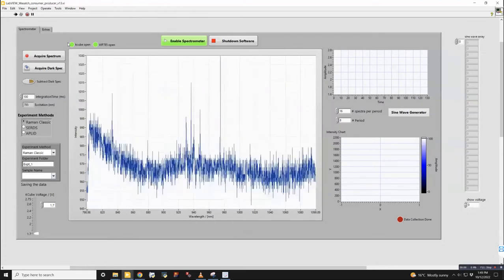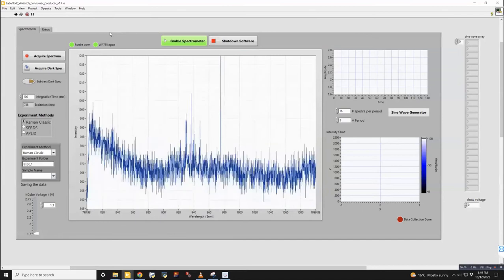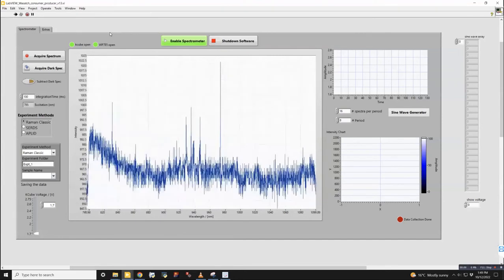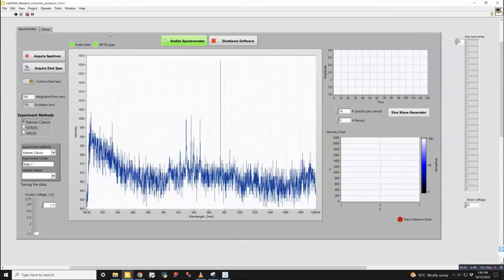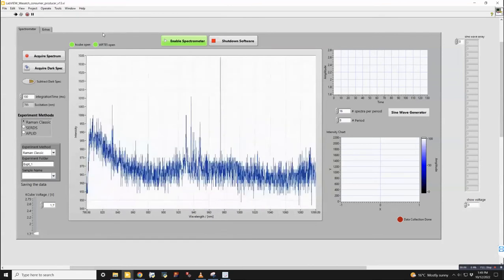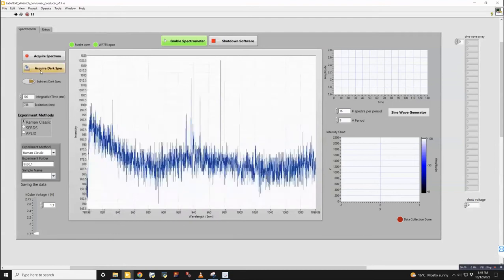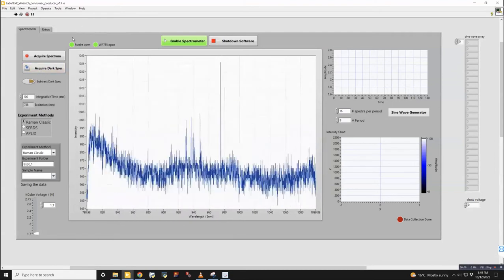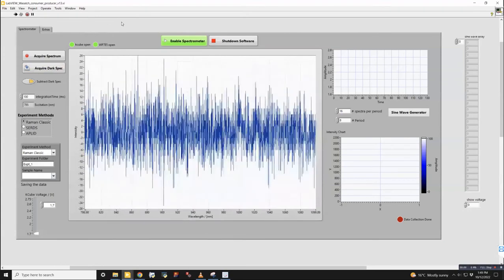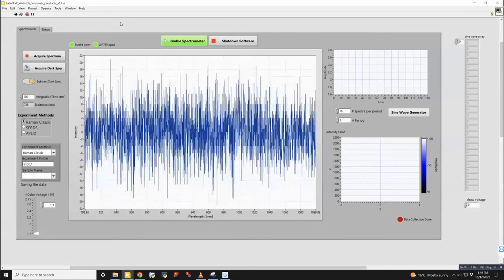Yeah, so I look for these green lights over here to make sure that I've successfully initialized the connection. Right now the laser's off, so this is the raw pattern that the detector is going to pick up in the absence of any light that it's collecting. So in order to account for this, you can acquire a dark spectrum. So this is saved in memory, and you can subtract it away so that all that remains is the noise on the detector. This is dependent on the exposure time.